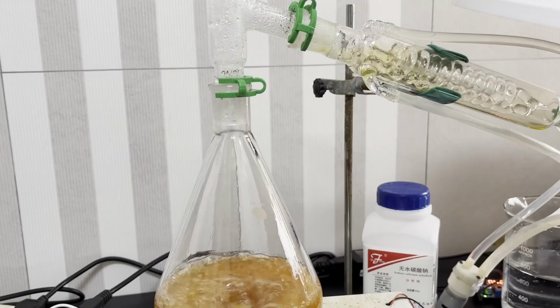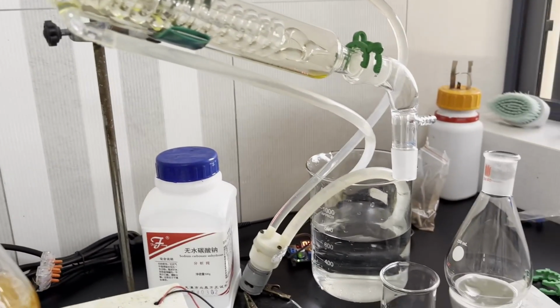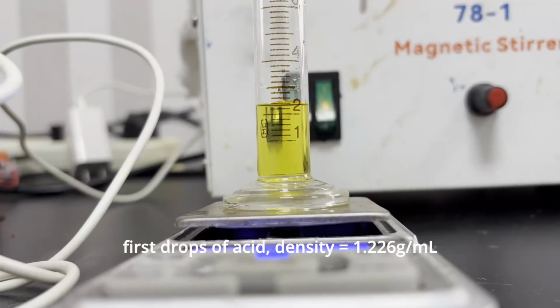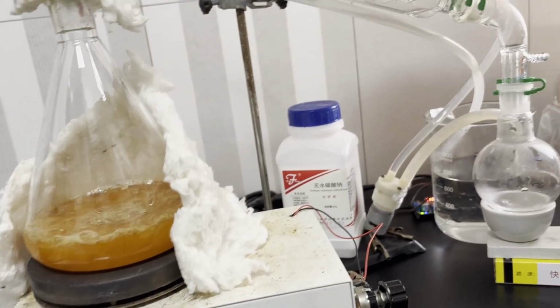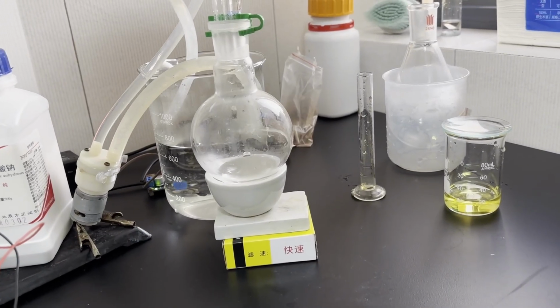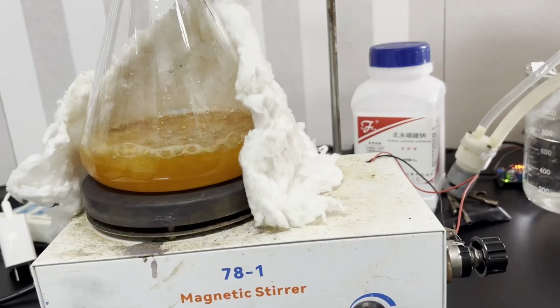The mixture soon boils and the yellow bromine vapors are pushed forward by the colorless hydrogen bromide vapors. The initial drops of acid are yellow, and their density is only 1.226 grams per ml, which was far from the 1.5 grams per ml of azeotropic hydrobromic acid. After I collected around 20 ml of this rather dilute acid, the bromine color nearly disappears, and I changed the receiving flask to collect nearly colorless hydrobromic acid.